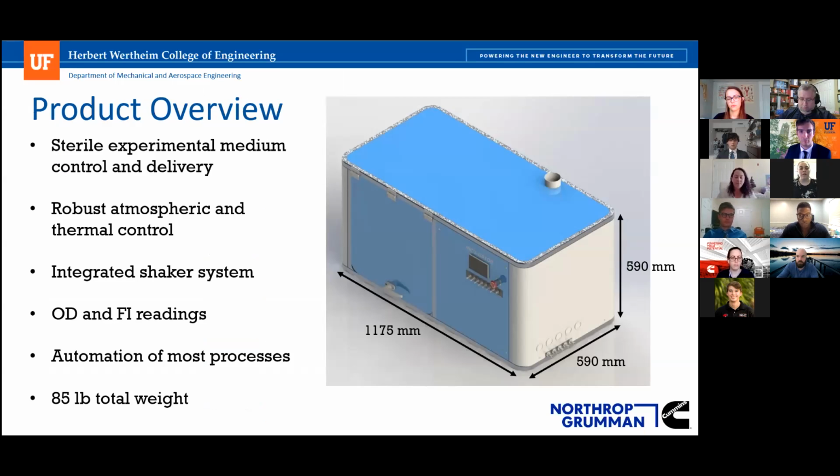Yeah, so now we're just going to talk about a little bit of our product overview. We use the full size requirement outlined in the customer needs, and those dimensions can be seen on the picture. We are going to highlight that sterile and experimental medium control and delivery, that we have robust atmospheric and thermal control. We have an integrated shaker system, and then we are capable of taking OD and FI measurements and readings, and then we have automated most of the processes. The only ones that are not are like refilling fluid tanks. And then the last little point of information is that we have an 85-pound total weight.